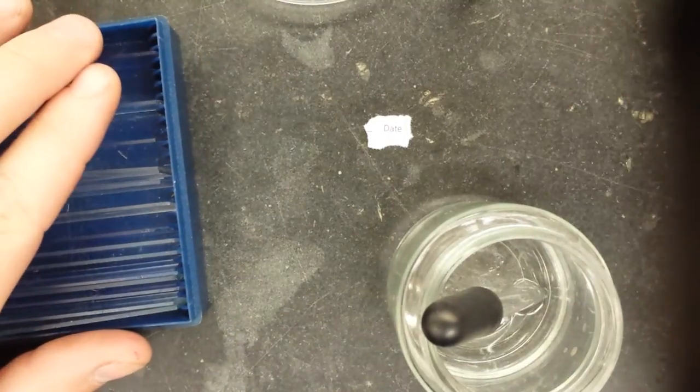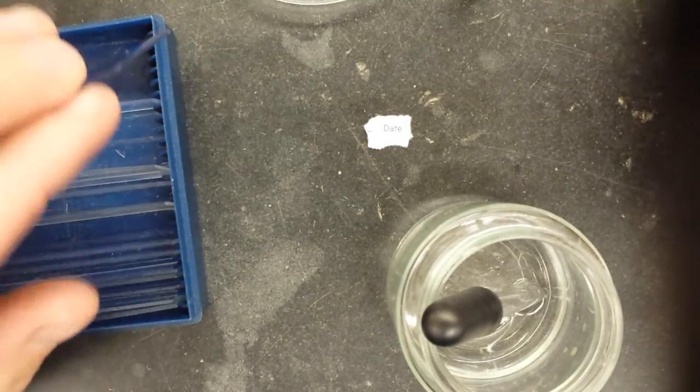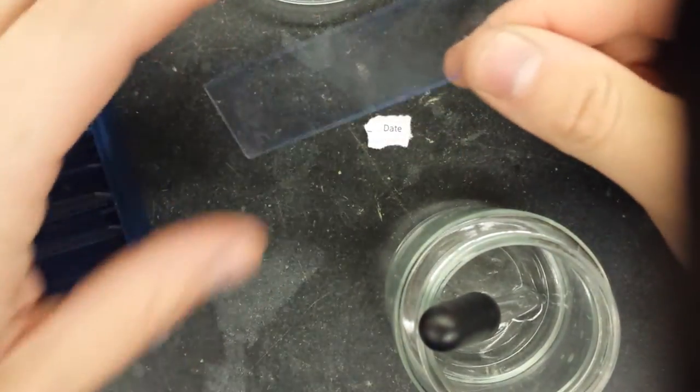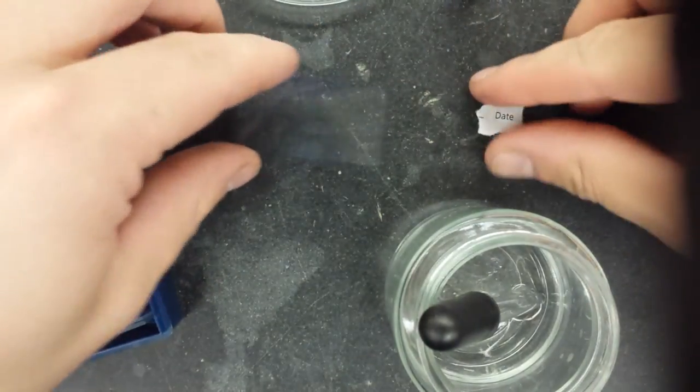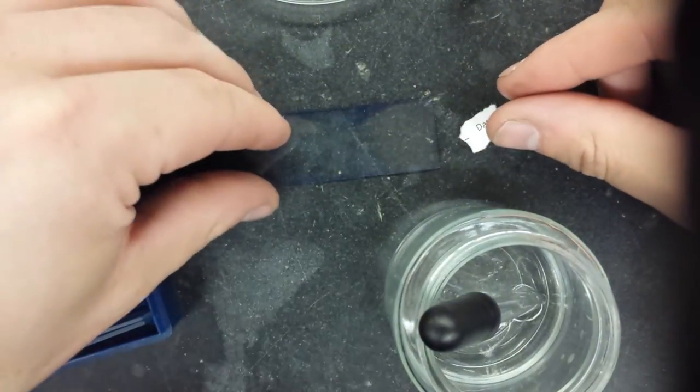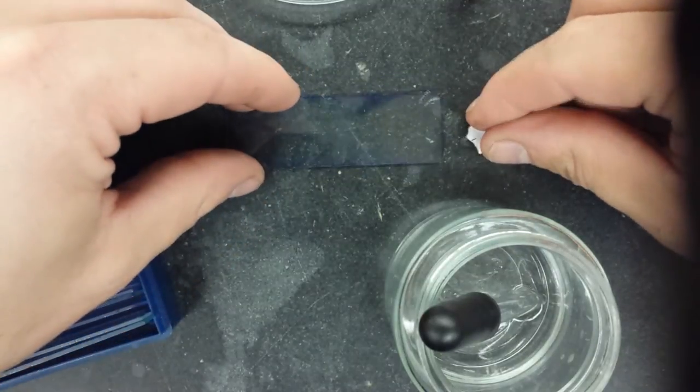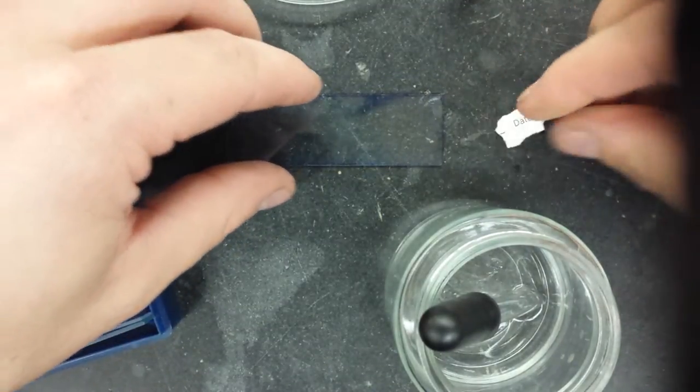Just making a video... you're on YouTube now, no you're fine, I can maybe edit that out if I feel like it. So you'll need your slide and your specimen with the letter in it.